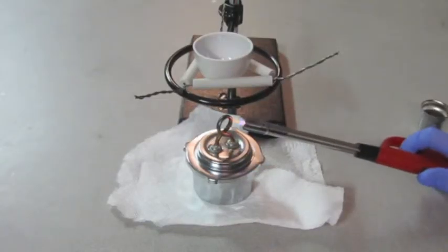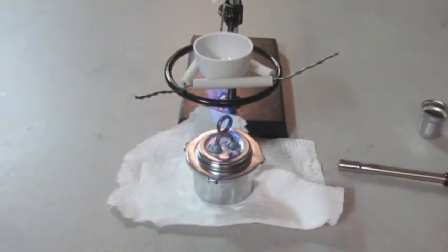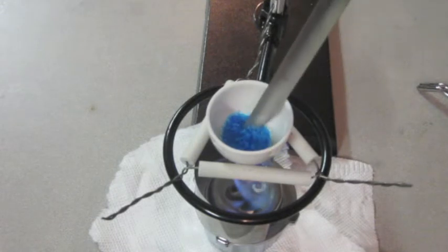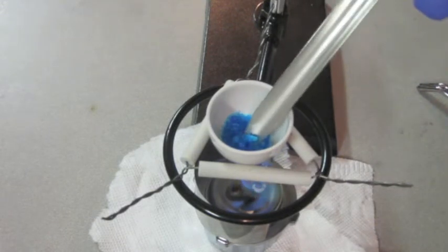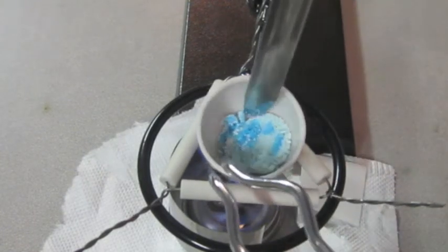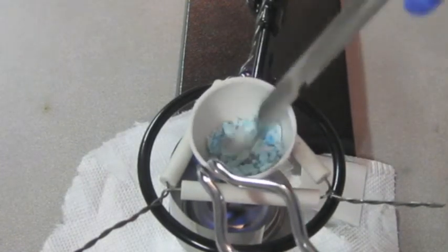This is because powders dehydrate much more quickly than large crystals. Now simply heat the copper sulfate with a torch burner until all of the water boils off. It should start clumping together like this within a few minutes and it may even form a large block on the bottom. Do your best to break up any chunks and expose as much of the still-wet salt as possible.